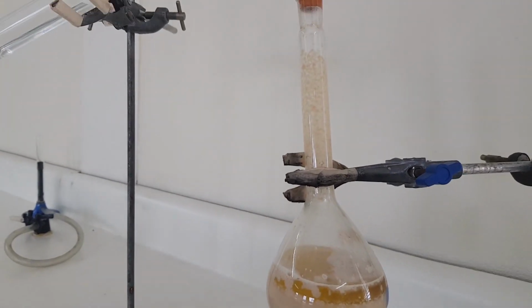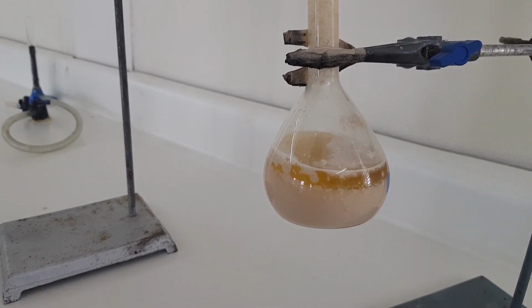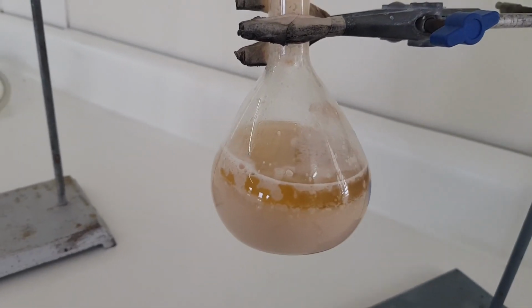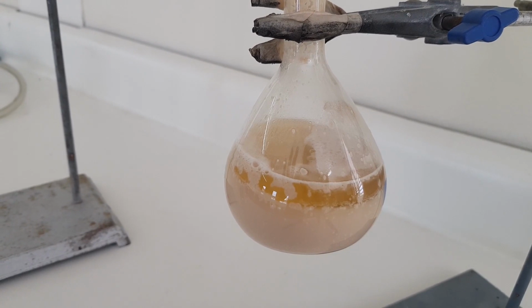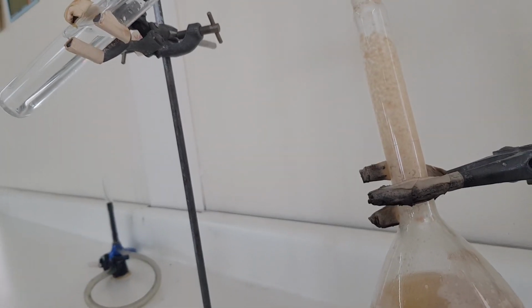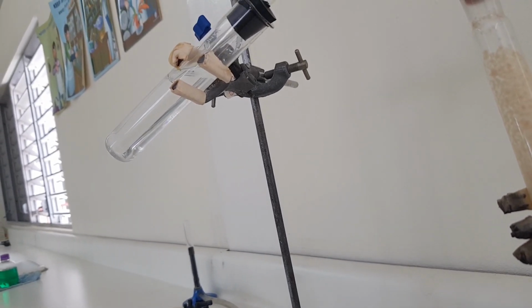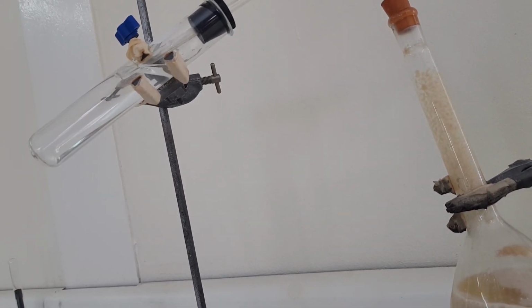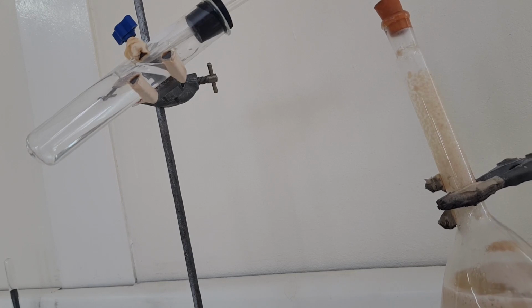And we'll bring it a little bit closer so that we can see what's happening in the flat bottom flask, if you all see any effervescence occurring. Right? And now you all should be seeing that there, and at the same time you should be seeing bubbles or effervescence happening over here as well. Right, now you have to note the rate at which those bubbles are being formed.